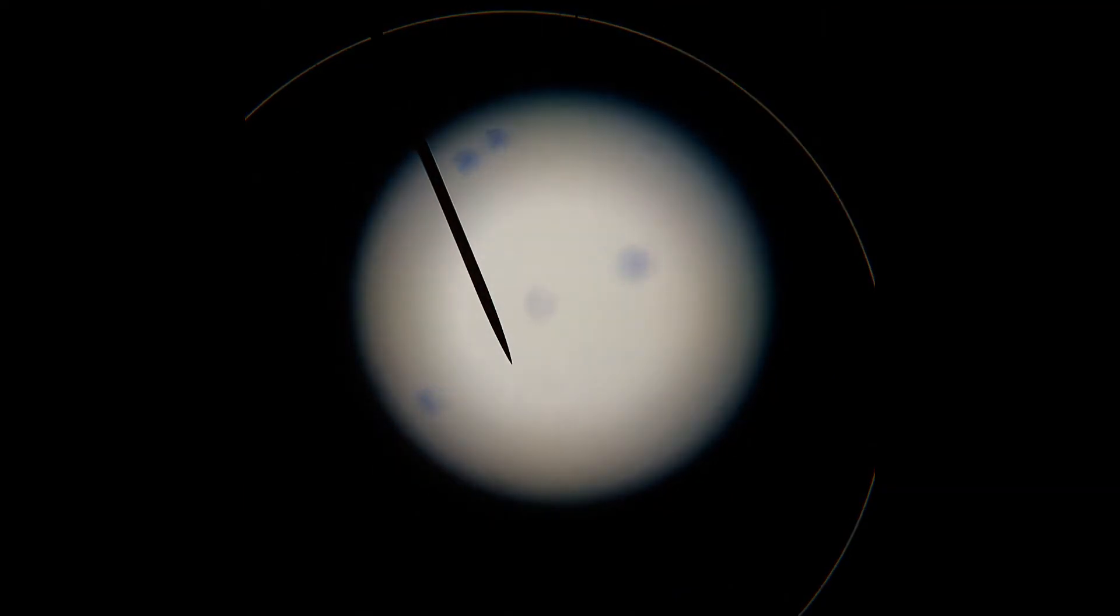I will now use just the fine adjustment knob and there I've got some beautiful cells.